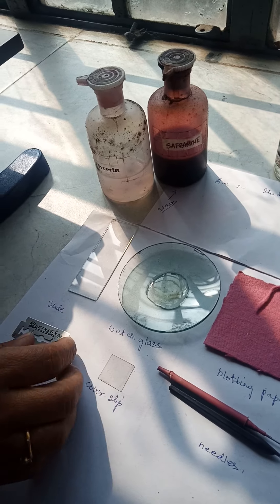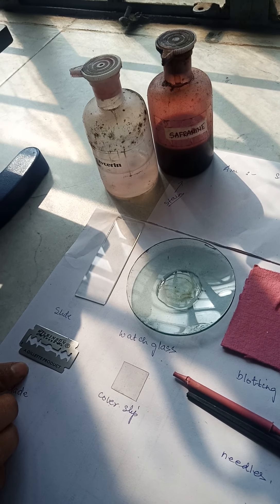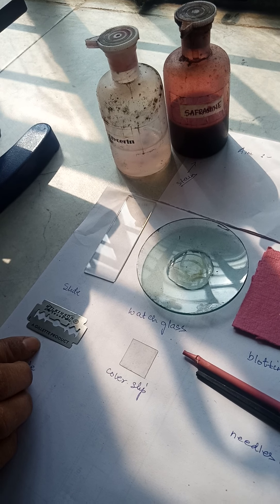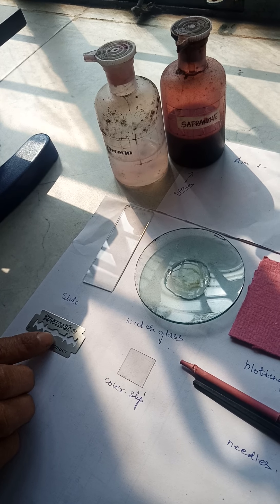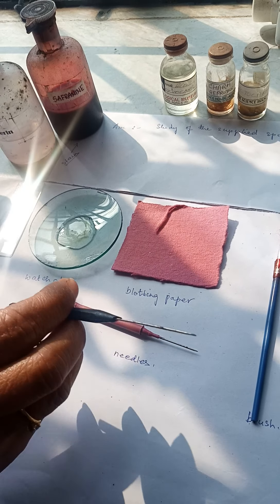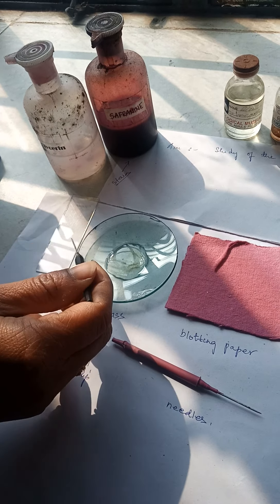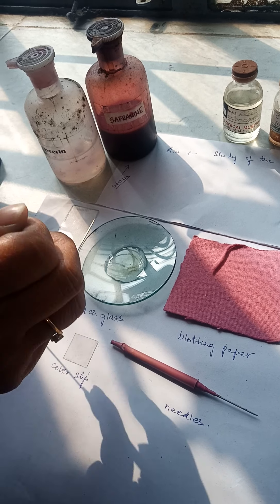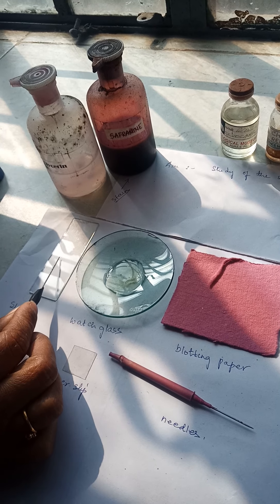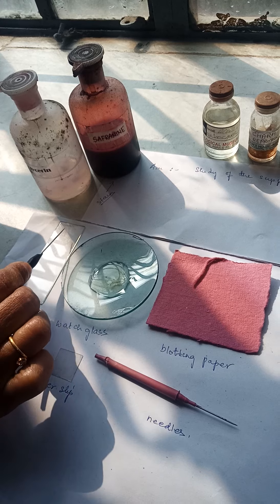Since we are doing algae, which are already very small, you don't need a blade for algae. But when you are doing bryophytes and cutting the stem and reproductive structures of pteridophytes, you will need a blade — always a new blade for botany practical. You also need these needles. Their purpose is to touch your specimen; you will not touch the specimen with your hand, finger, or nail.